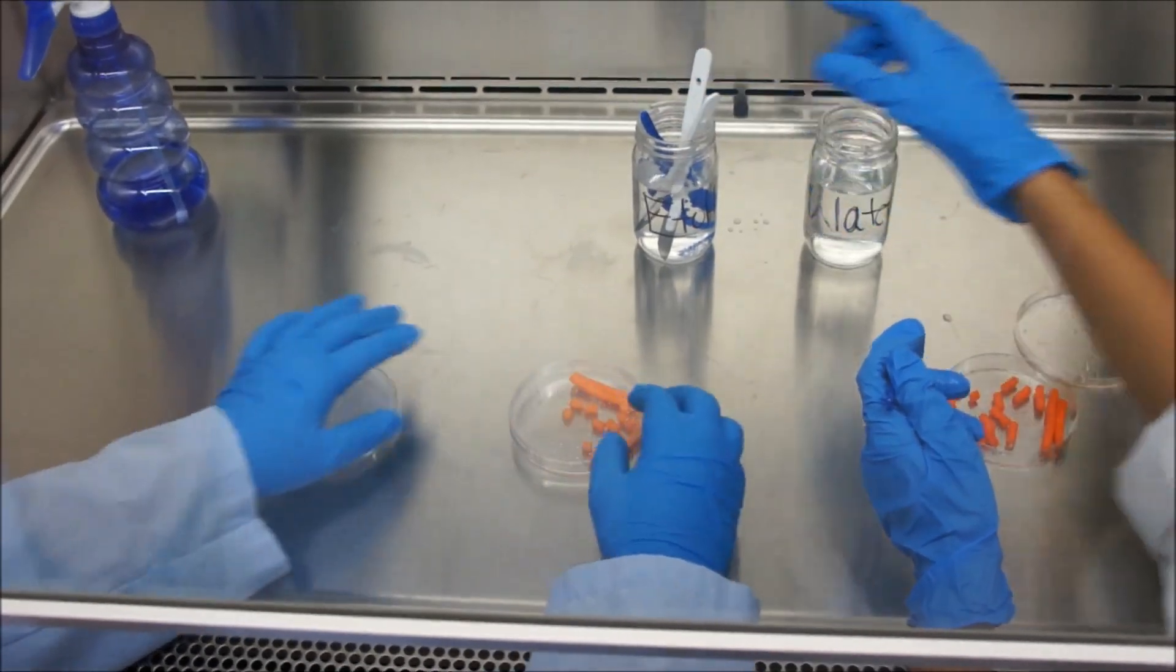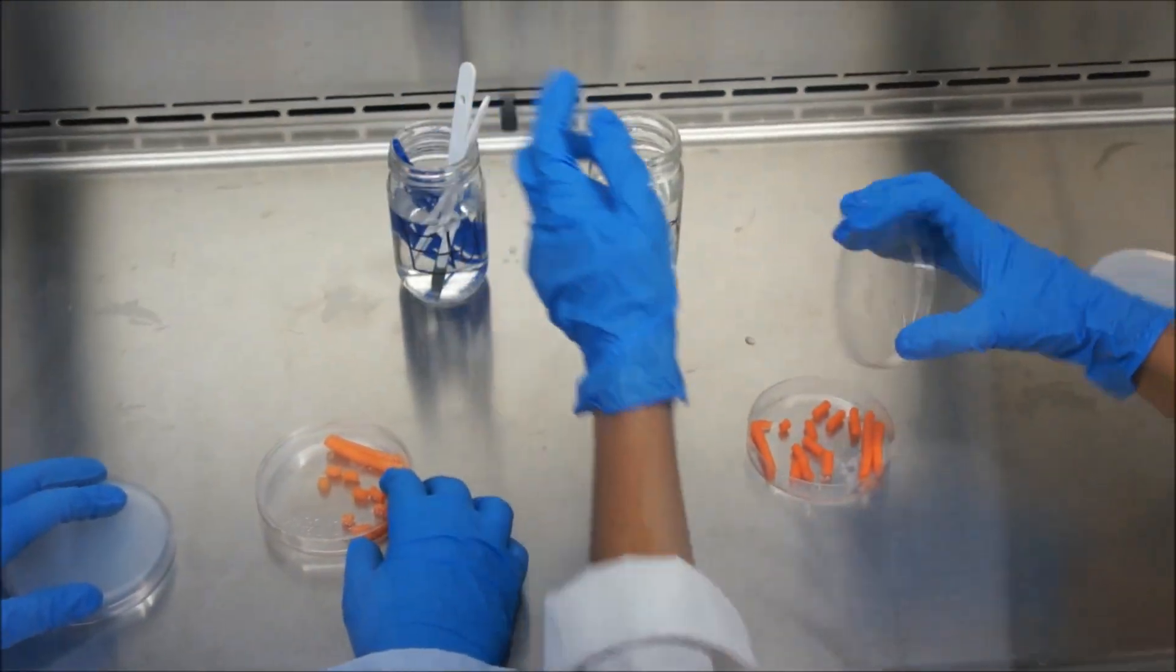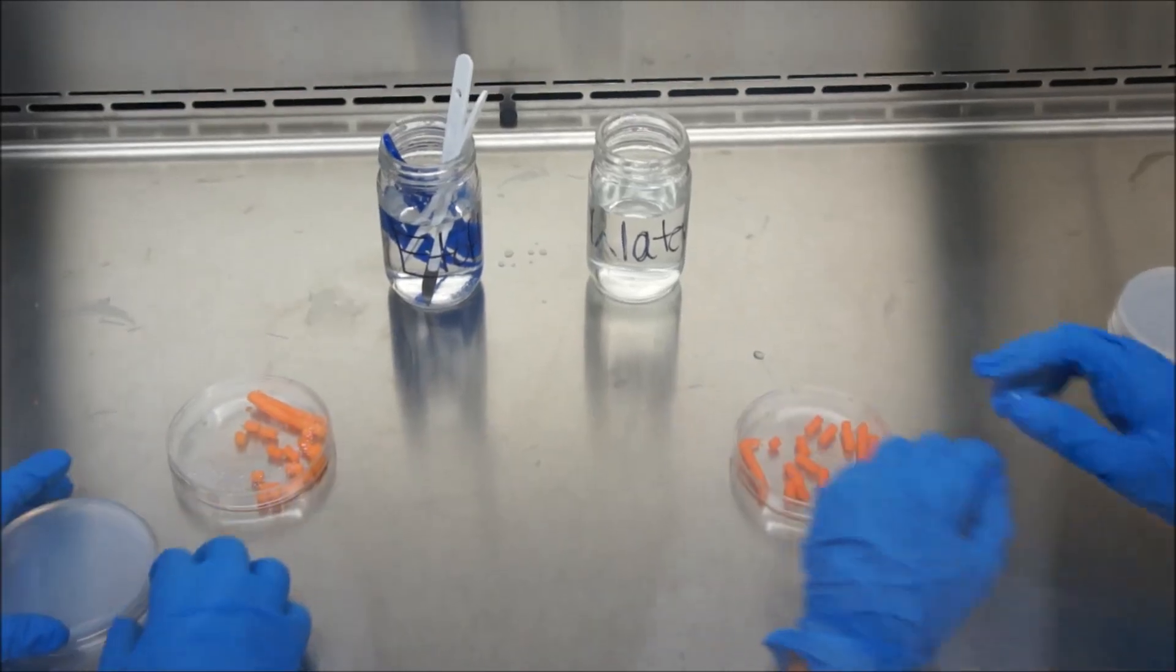Replace the lid on the dish. Wipe any debris from the tools and return them to the ethanol.